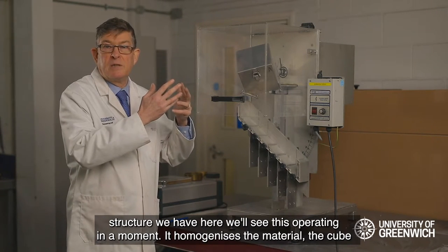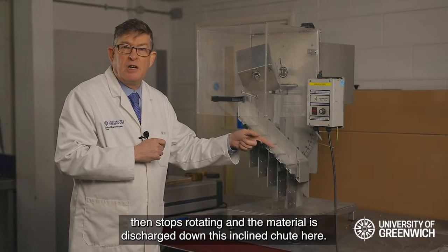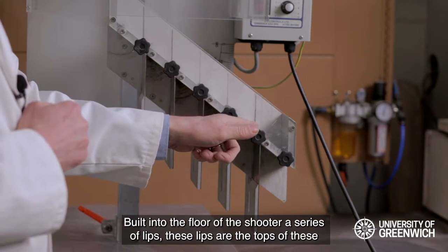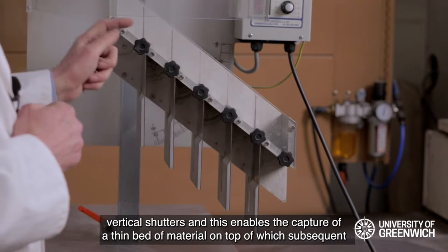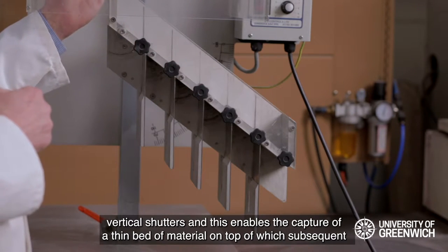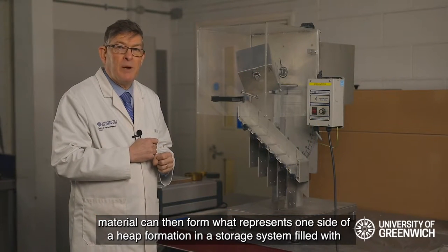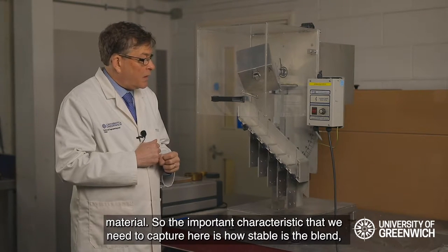The cube homogenizes the material, then stops rotating and the material is discharged down this inclined chute. Built into the floor of the chute are a series of lips — these lips are the tops of these vertical shutters — and this enables the capture of a thin bed of material on top of which subsequent material can then form.